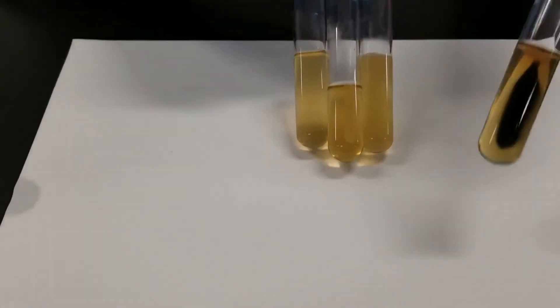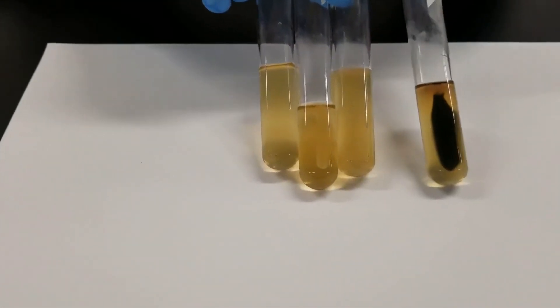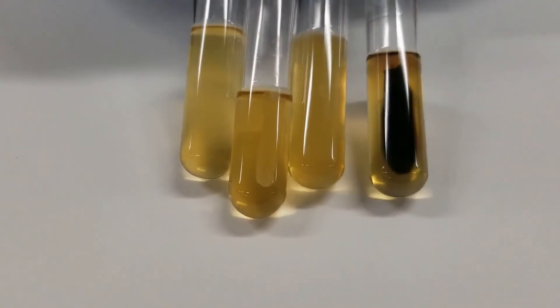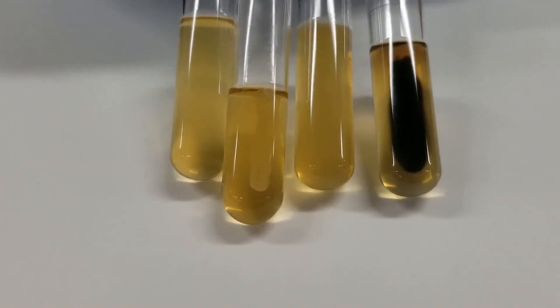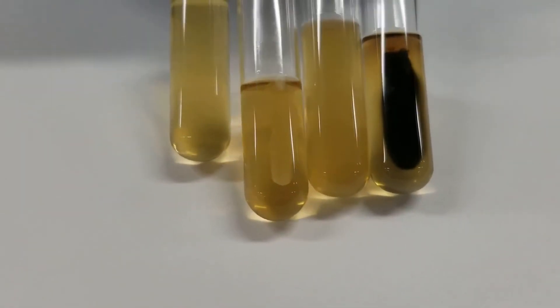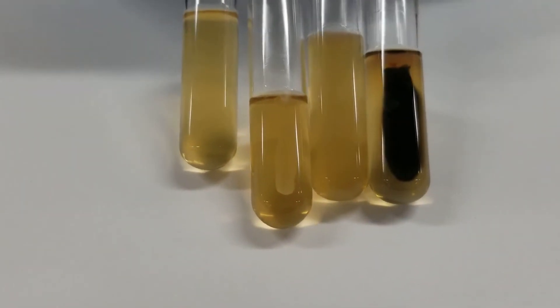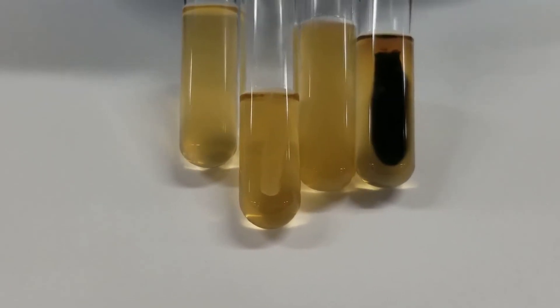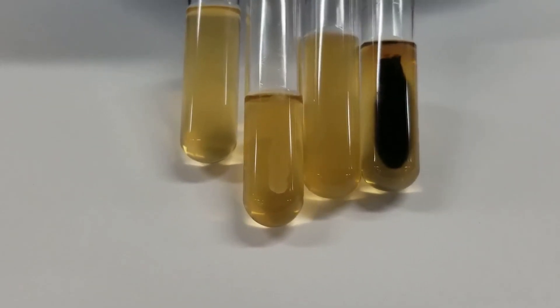I'm going to move back over to the white paper so you can see this well. This is Proteus vulgaris — notice a little difference in the color. The black indicates hydrogen sulfide production, definitely a positive.